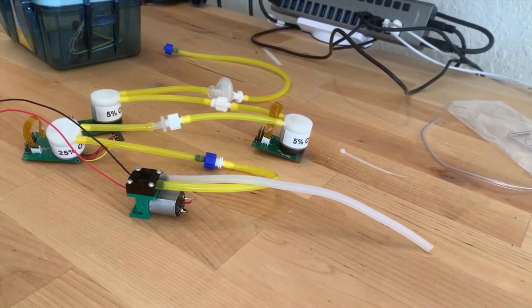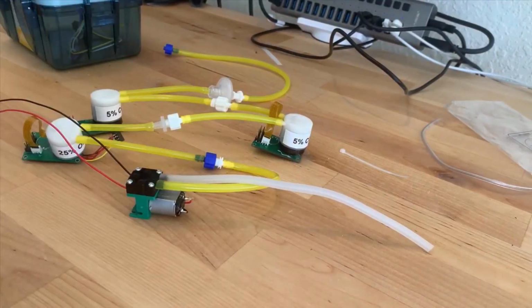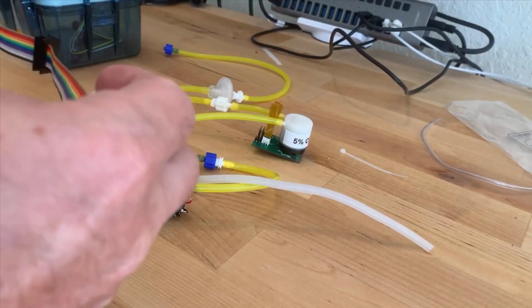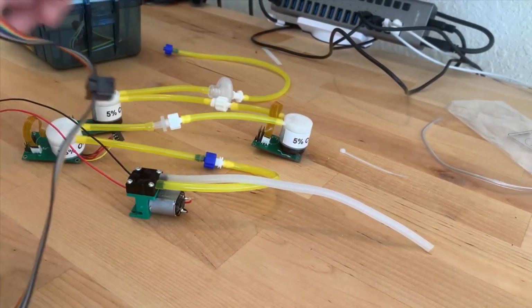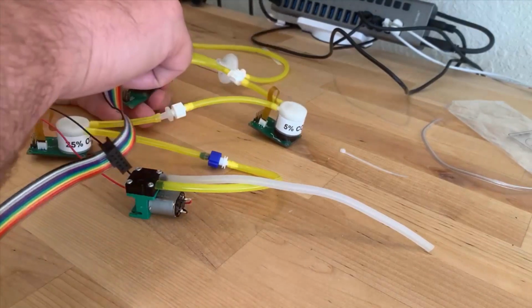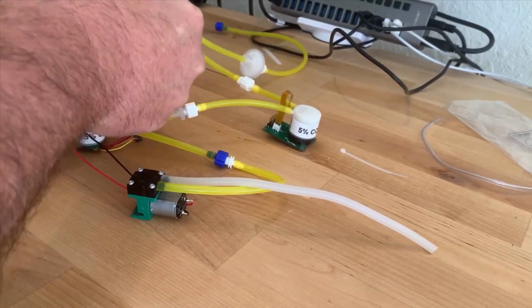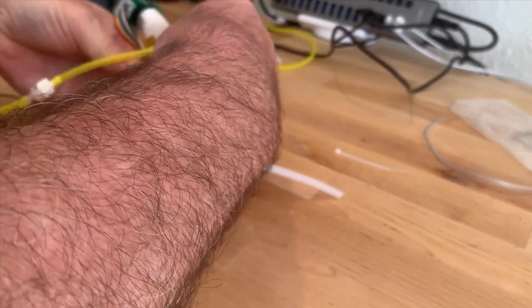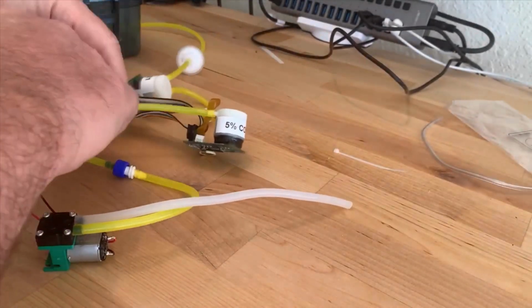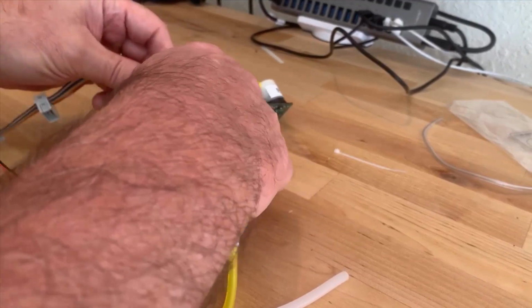In this video, I am going to connect the sensors up in daisy chain fashion so that we can communicate to all three of these sensors simultaneously. And we're going to do that with this flat ribbon cable here, which is going to allow us to connect to each sensor sequentially for a daisy chain. So I'll plug into this guy, and then I'll plug into this guy over here. And then I'll plug into this young fellow right here, so that they'll all be set to roll.